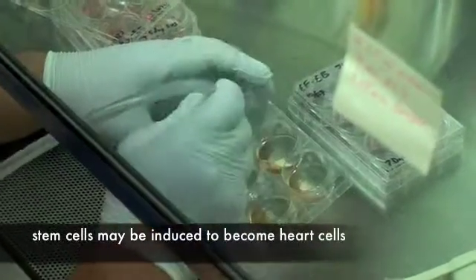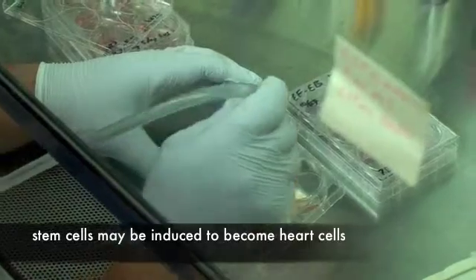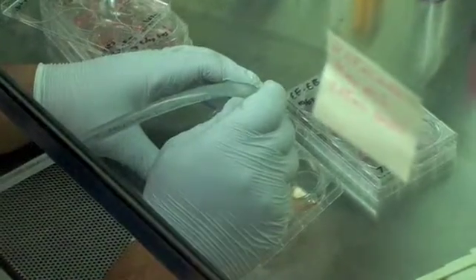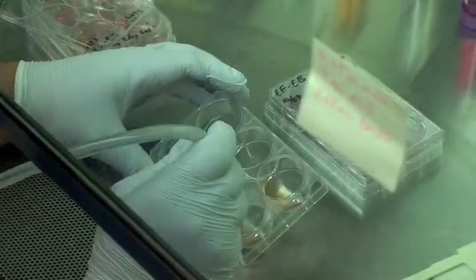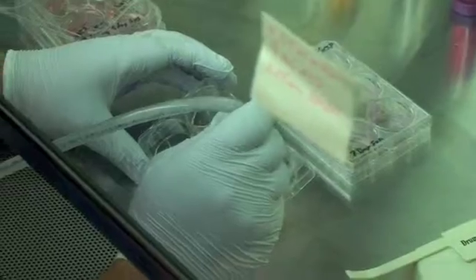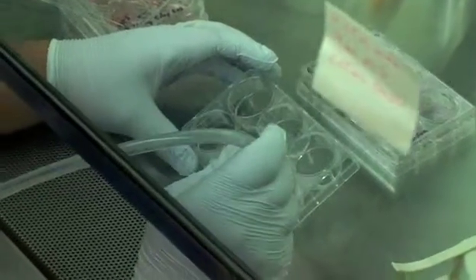We have also developed several efficient strategies in my lab for inducing stem cells down the cardiac lineage into spontaneously contracting heart muscle cells.